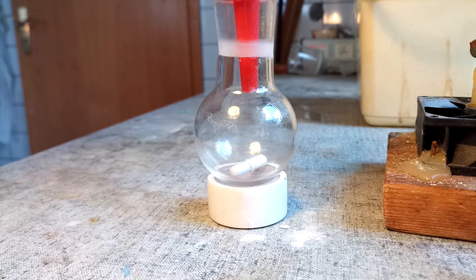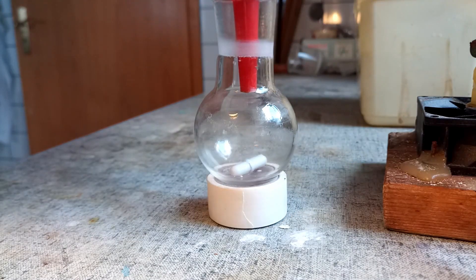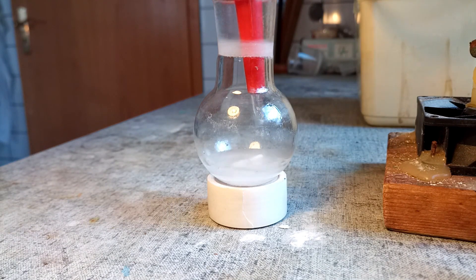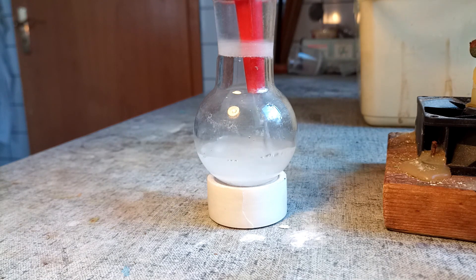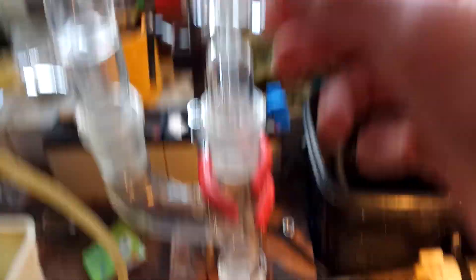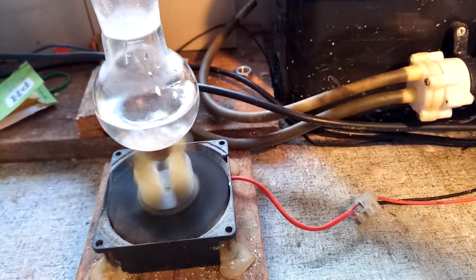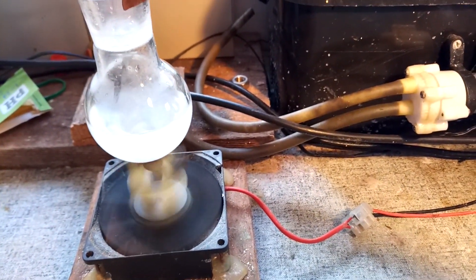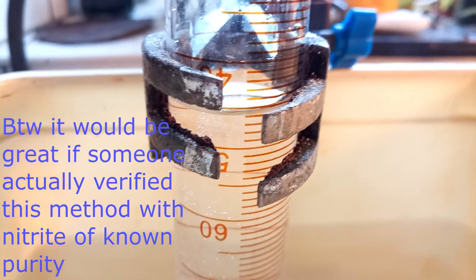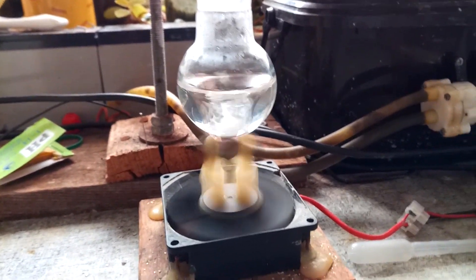The way we go about this is by adding about 200 milligrams of our crude nitrite product, along with a gram of urea, into a flask, and dissolving that in about 20 mils of water. Next, about 5 mils of dilute nitric acid — in this case about 10 to 20 percent — is added to it, and we measured the amount of gas produced. To really drive the reaction to completion, we can also go ahead and heat it a little.